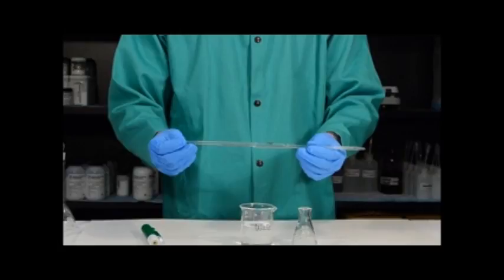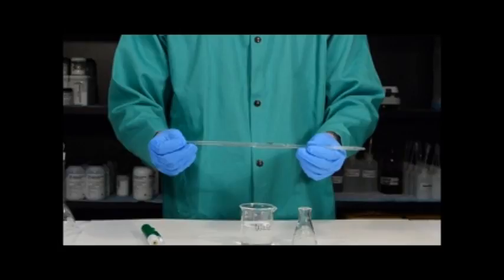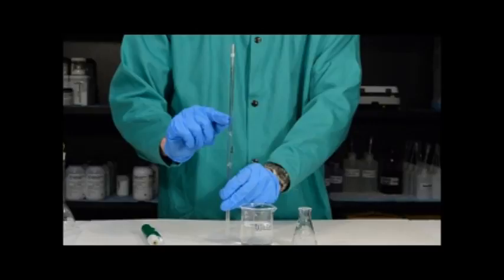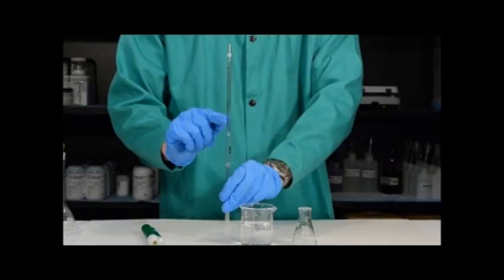A five milliliter volumetric pipette has just one job: to transfer five milliliters of liquid into another container. You'll see here that it has what's called a calibration line, which is the only marking on a five milliliter pipette. This is the level at which you want the liquid to be in order to deliver five milliliters.